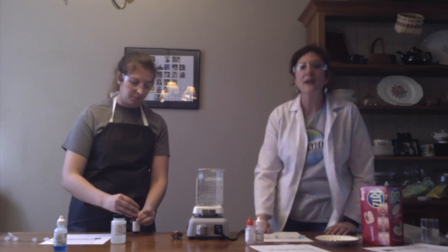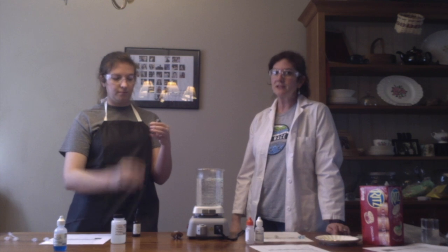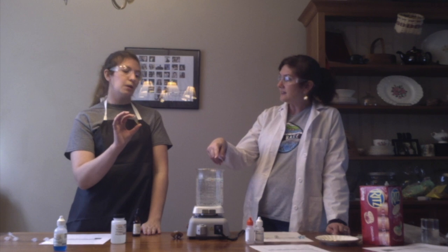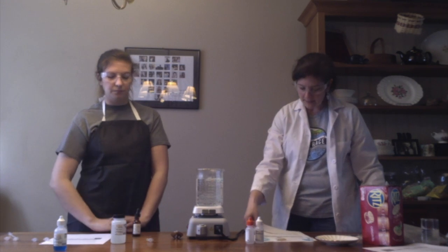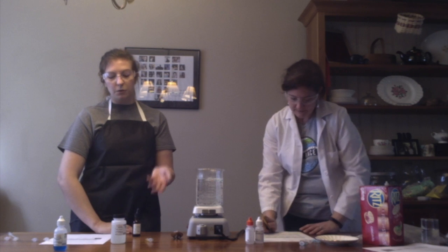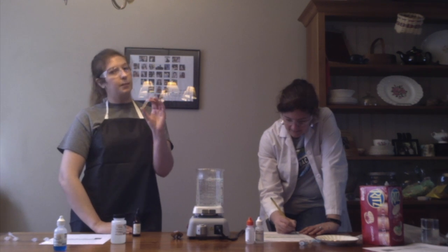And this serves as a what? Control. Because scientists may be lazy, but we don't want to do this experiment twice. We want to make sure what we're testing is what we think we're testing. Now, does iodine need heat, Lizzie? No, we don't need to heat this one. So we have results right away. Tell us about what happens when we have that iodine and water. So again, like we saw with the samples, the iodine just looks diluted. It's still a very pale yellow.